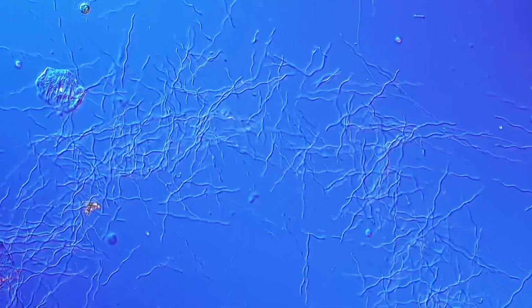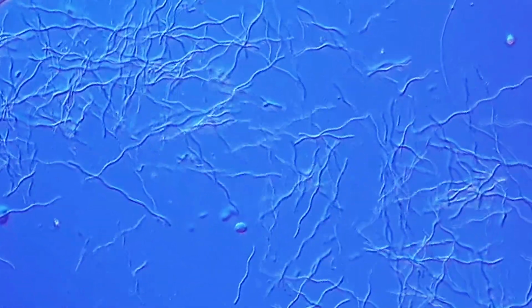Now, how do those disinfectants even work? Well, those disinfectants contain in many cases either alcohol and or hydrogen peroxide, and the activity of those two substances is a little bit different, because alcohol disrupts the cell membrane of the bacteria and of other cells, and this causes the cell membrane to burst open and the contents of the cell to spill out. And hydrogen peroxide, on the other hand, is highly reactive. It produces highly reactive oxygen radicals, and they react with pretty much anything that's organic. So essentially the hydrogen peroxide indiscriminately starts destroying molecules in the cell, and of course the cell is not able to survive that.